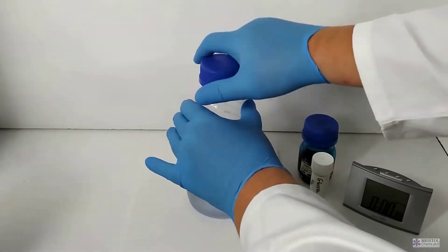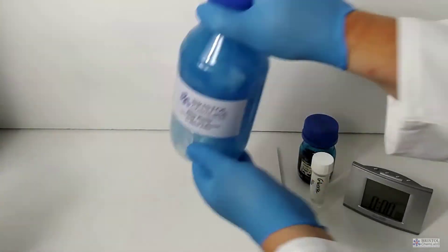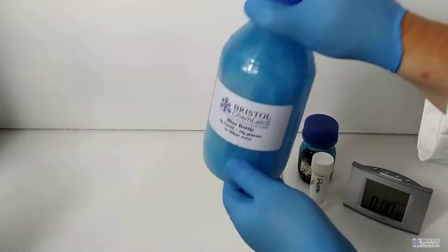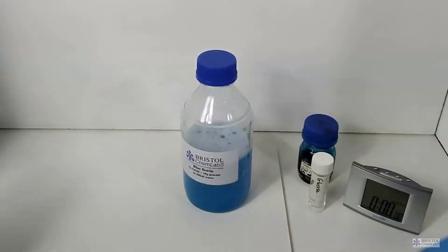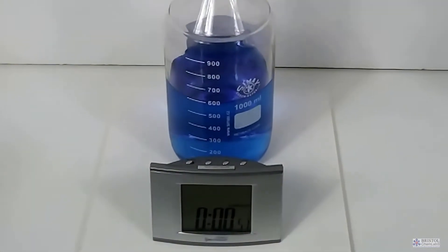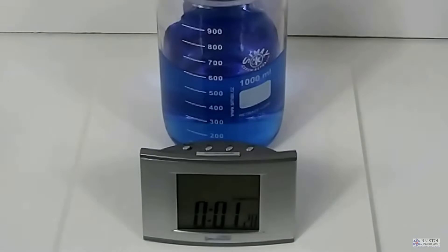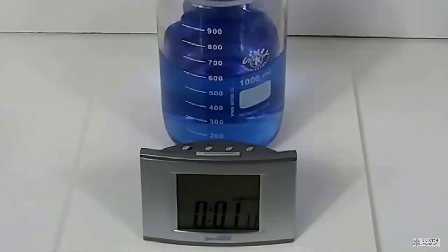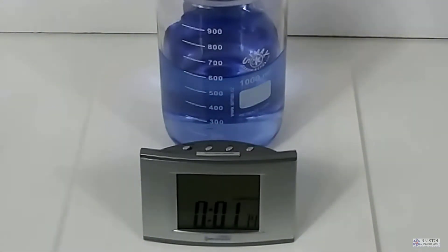The reaction itself is simple. Shake up the solution. The reaction requires the oxygen in the air, in the air gap above the level of the mixture. After a few minutes, the color decreases. The reaction reverses.